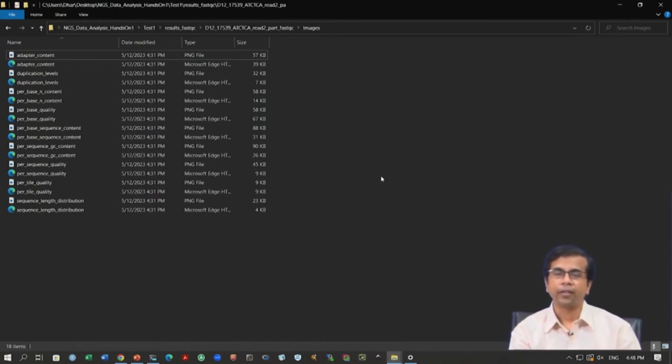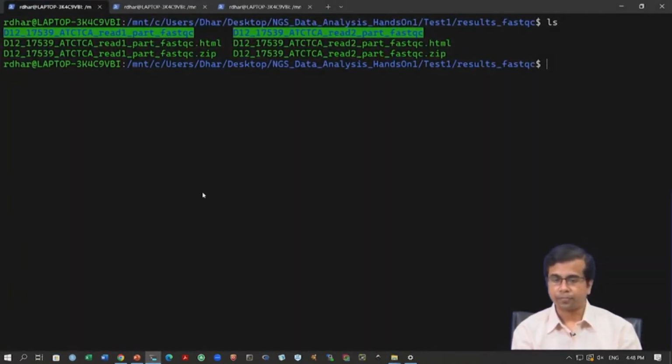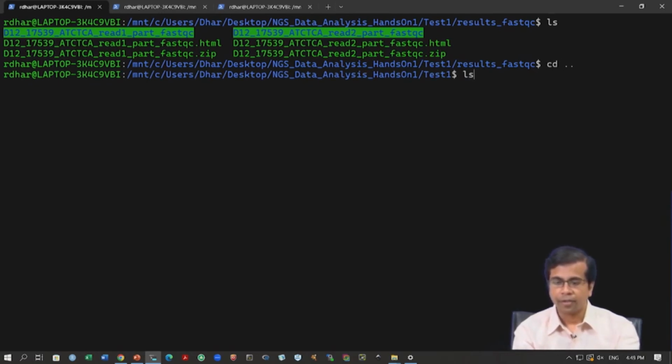Okay. As we have mentioned, once you have done the quality control, you get the results, you evaluate the results, you go into the pre-processing if it is required. In our case it is required, right. We have adapter contamination, we will do trimming and then we check it back with the FastQC, right. So, once we have done trimming, we check it through the FastQC again. Okay. So, let us do that, right. So, let us first come out of this folder, right, and let us do the trimming.